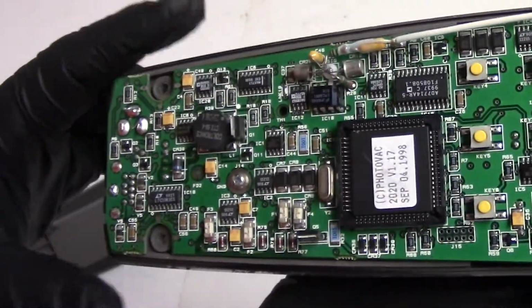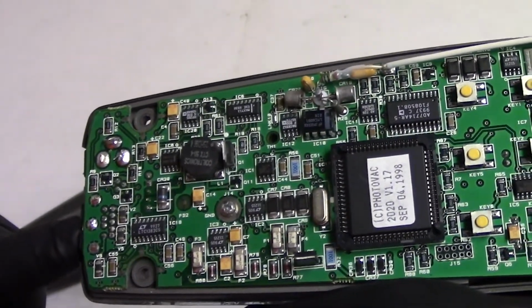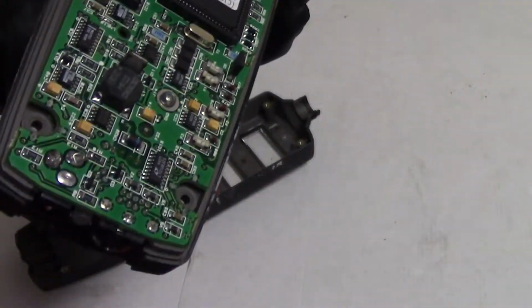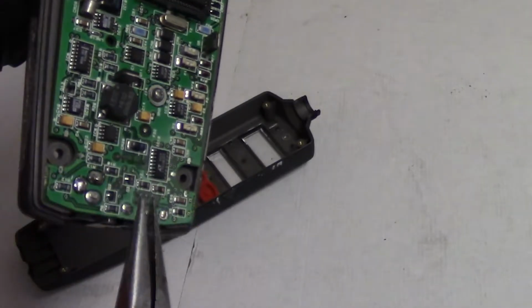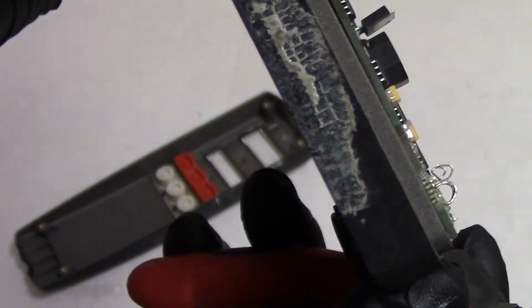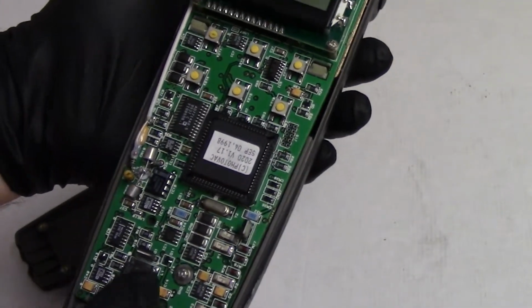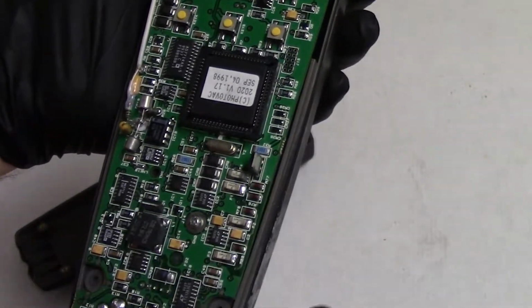So anyway, let's do a quick tour of what I have figured out so far. That's our serial port, I believe. Charger port in here. And what I did, and we're going to actually see this soon, is I soldered little loops on there, so I can connect it up to a power supply and we can drive it and see what happens. So it looks like power. This is probably the charger for the NiCad.